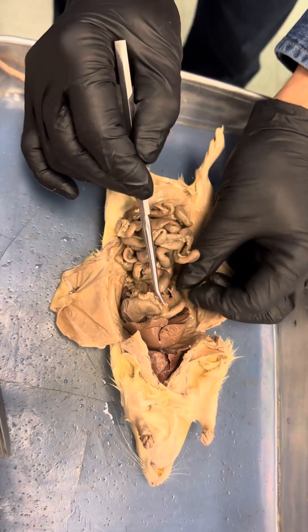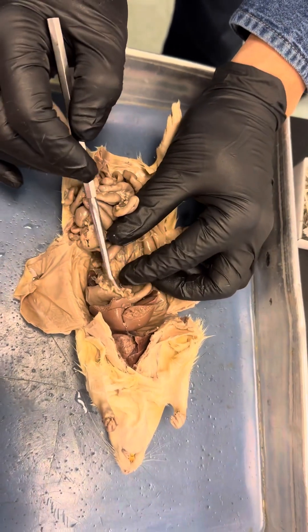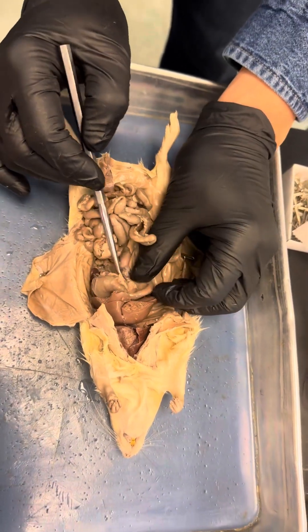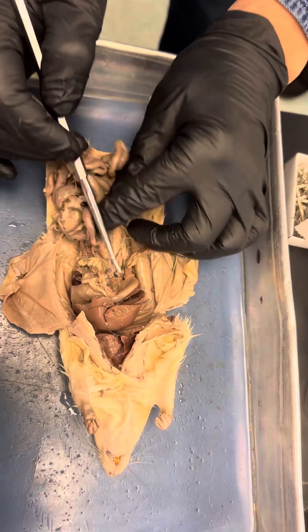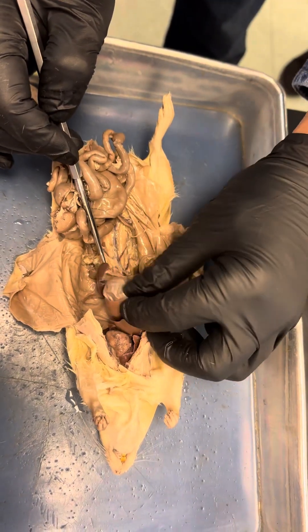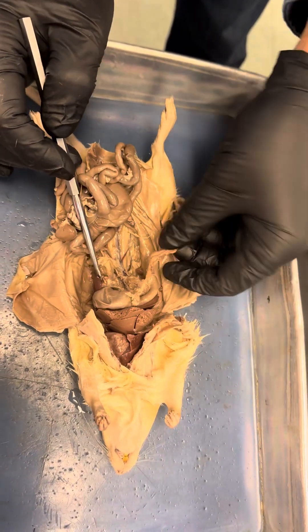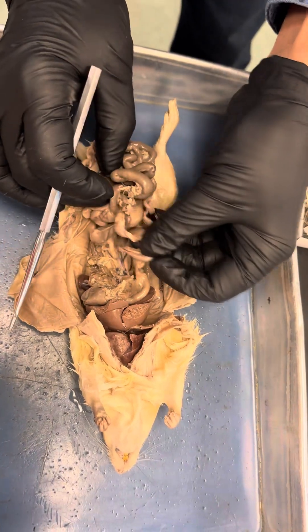This is called the spleen. And you can see here, pancreas — see, this is the pancreas. And duodenum and jejunum.